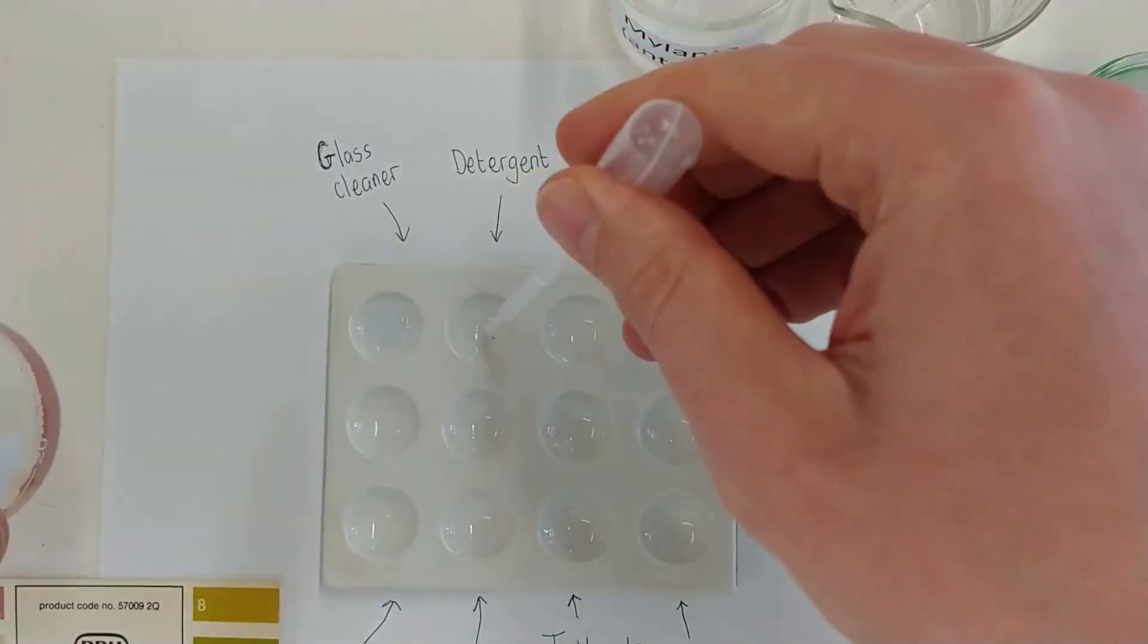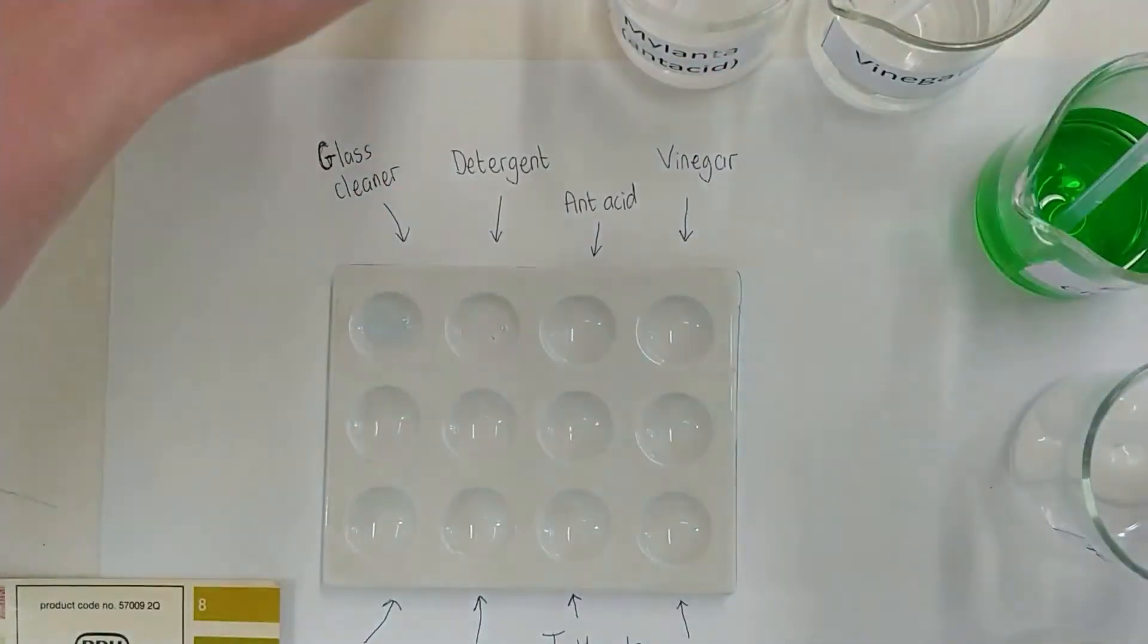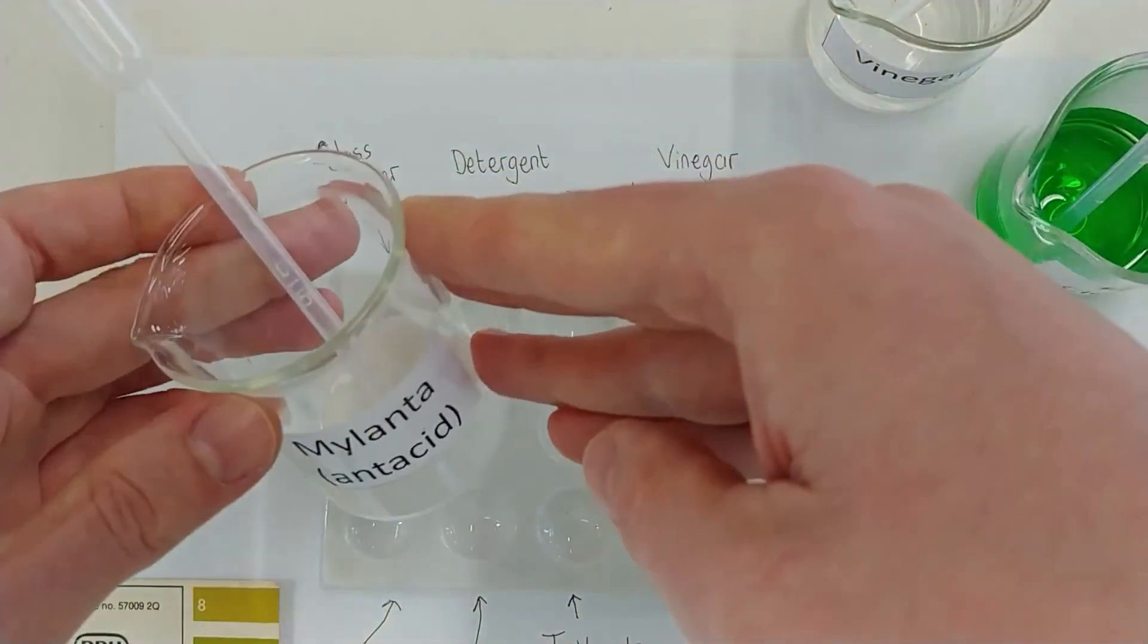Here is some detergent going in the spotting dish. It's all very exciting. Okay, I think we're going to speed up some of this.